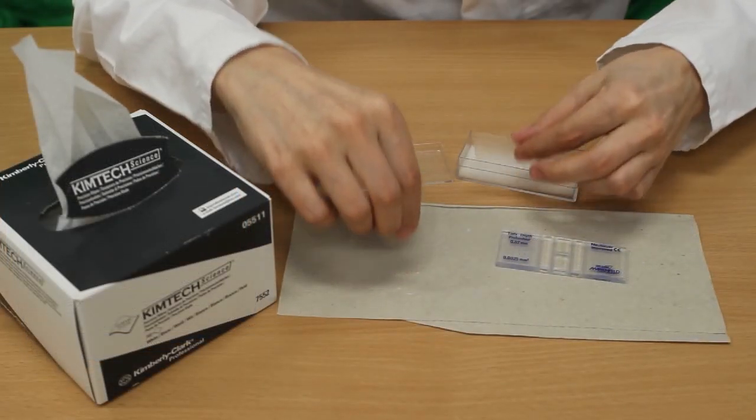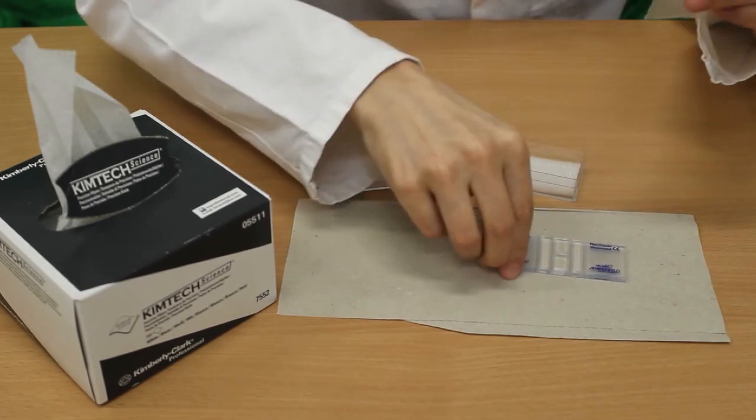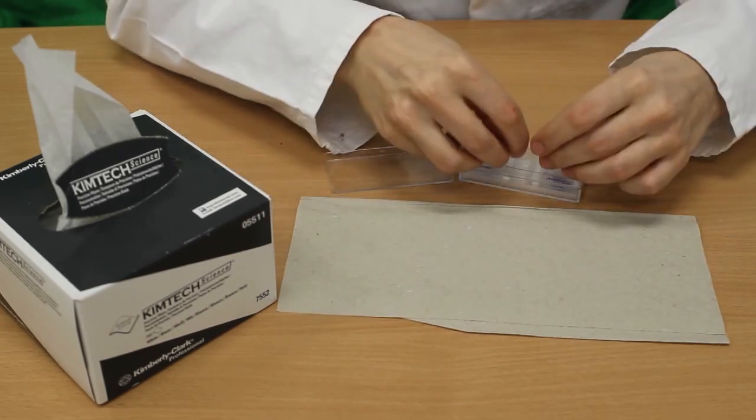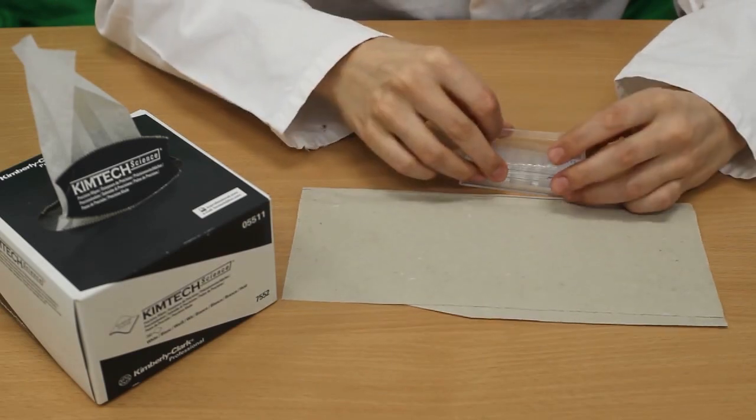Finally, when everything has dried, place the coverslip and the slide back in its box. Doesn't sound like you want to do this every day? Check out our resource section on automatic cell counters or visit our shop.